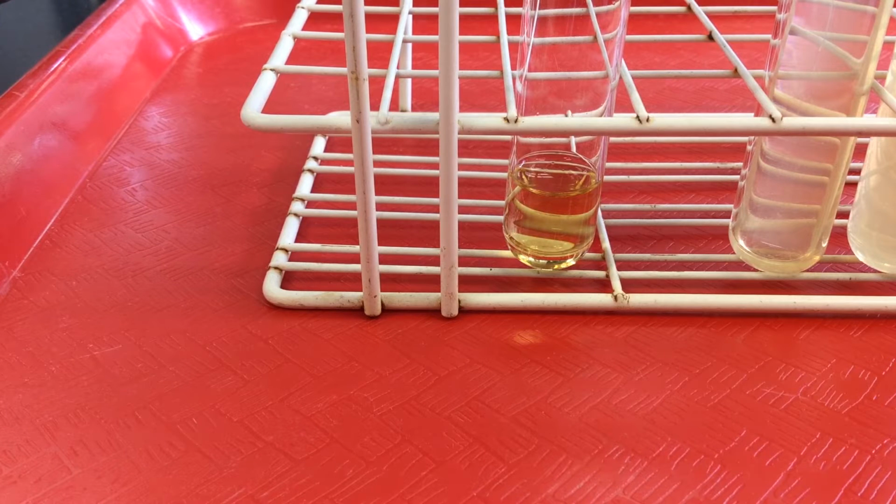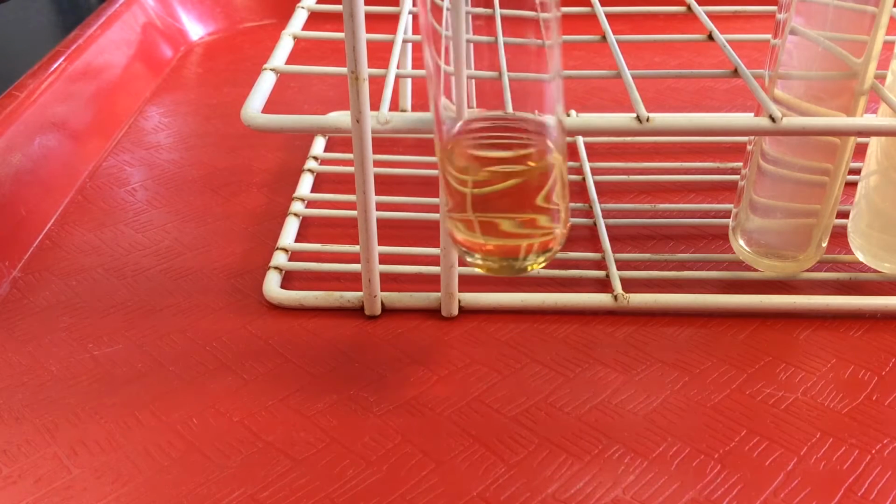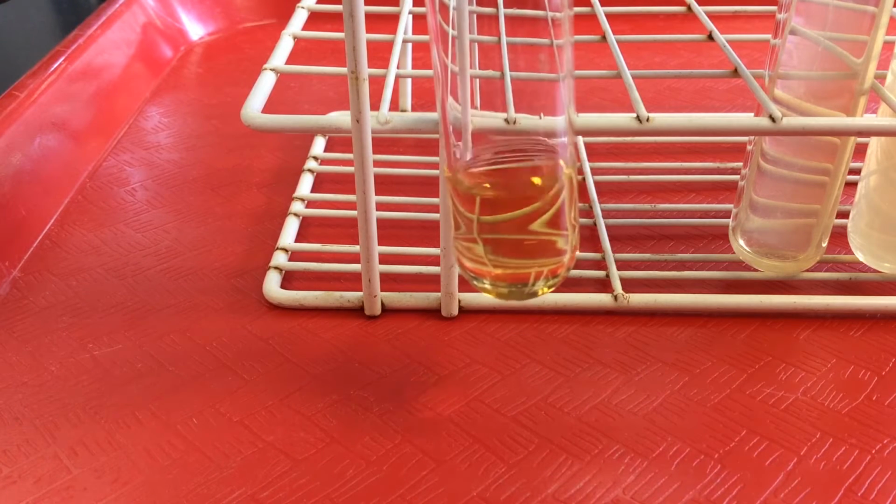Media is classified according to which ingredients are present, whether it's a liquid, semi-solid, or solid. So we'll start out with a discussion of media based on whether they're liquids or solids. The first type of media, a liquid media, would be referred to as a broth. And broth, we can think of like chicken broth or vegetable broth, almost like a soup.